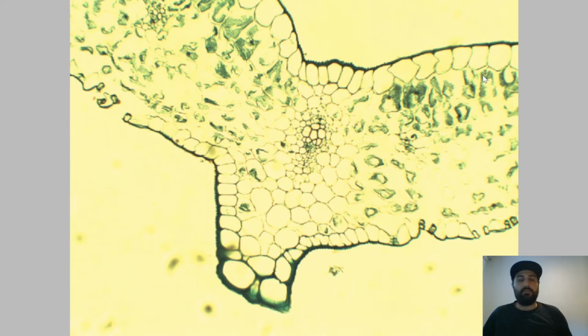It's where maximum photosynthesis is actually occurring. Again, you can see on this leaf here that I've been using, really dark on this side, not as dark on this side. This side's the side that's facing the sun most of the time. It's kind of like a solar panel looking for the light. It's just trying to get as much of that light energy coming in so that the photosynthetic reaction can actually take place.